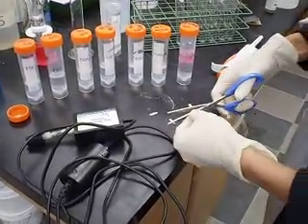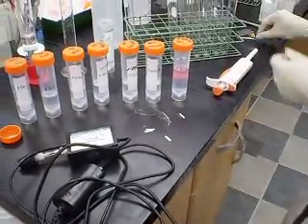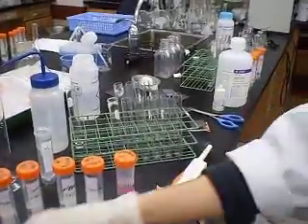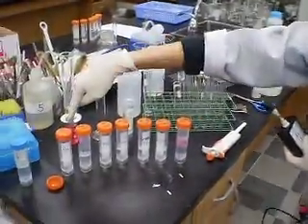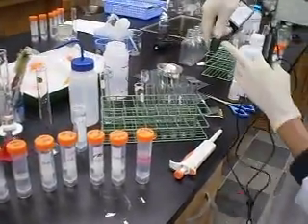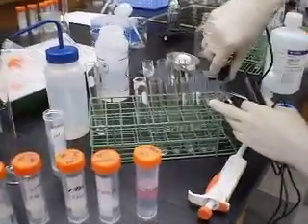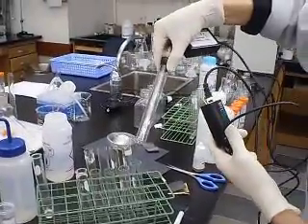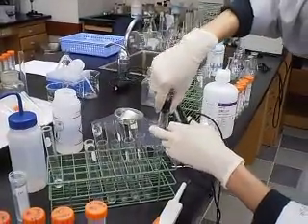So I'm just doing a trial — four strips. Test tube size has to be the same as well. This is the gas pressure sensor. I'm going to put about 5ml of solution into this test tube. This gas pressure sensor has a stopper — we're going to stop it, pressure will build up, and we're going to link this to Logger Pro to measure the rate of hydrogen gas production, or the pressure change against time.